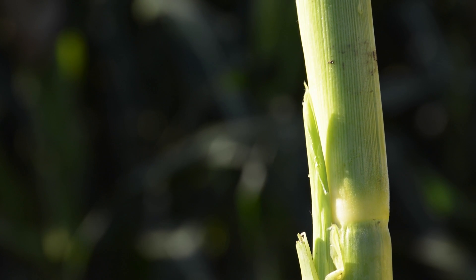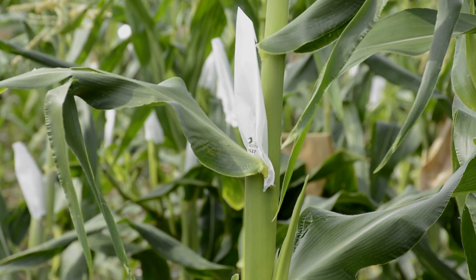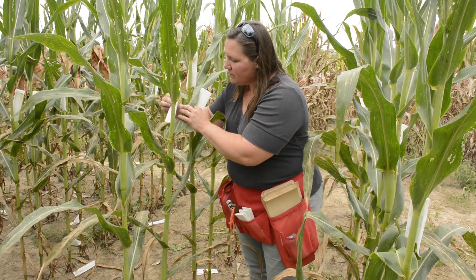The very first step in making controlled pollinations is to prevent unwanted pollinations on the ear. When an ear is developing, there is initially at the leaf axil — where the leaf connects to the stalk — a tiny little ear shoot that is growing over time. Before the silks emerge, we need to put a shoot bag on the shoot, which prevents unwanted pollinations. We shoot bag every single day as our first task.